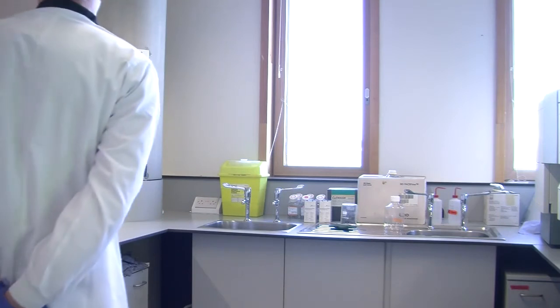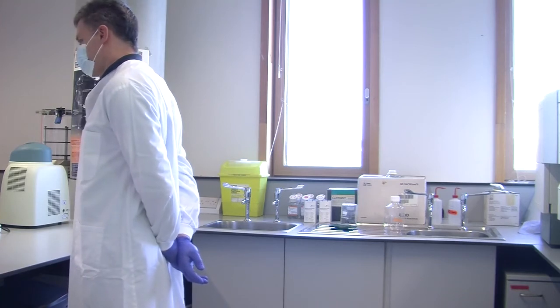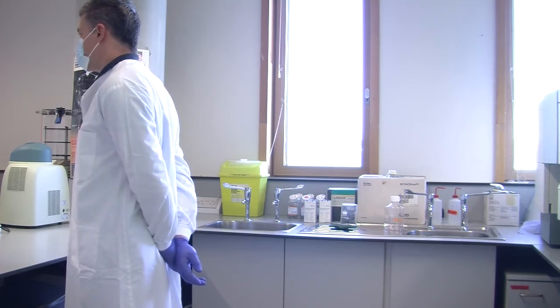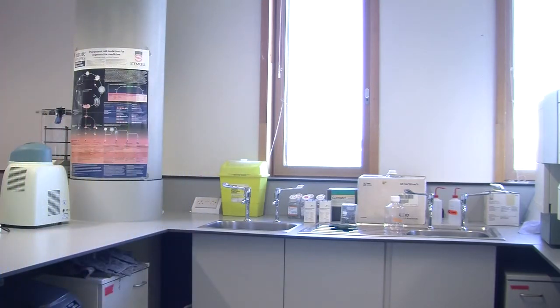You want to bring it to the level of your eyes, it makes it easier. Leave just a little drop inside to make sure that the cells are not lost. When you say pellet, it's going to literally be stuck. If you look, you should be able to see a little white. You can see just a tiny, tiny bit.